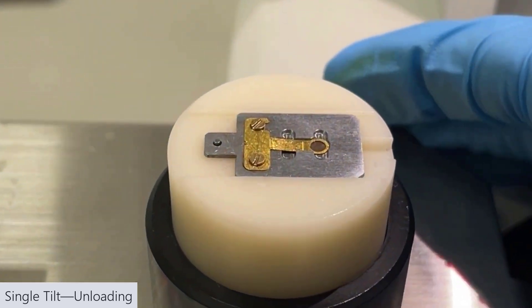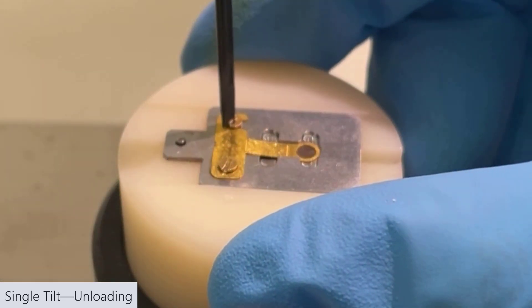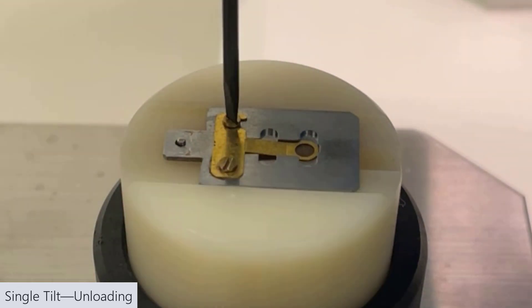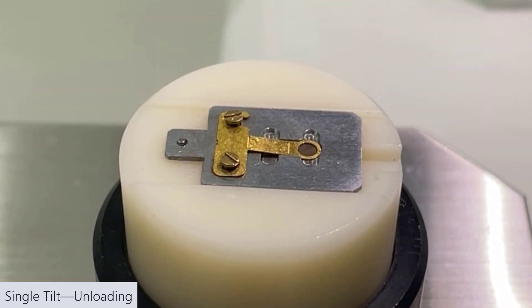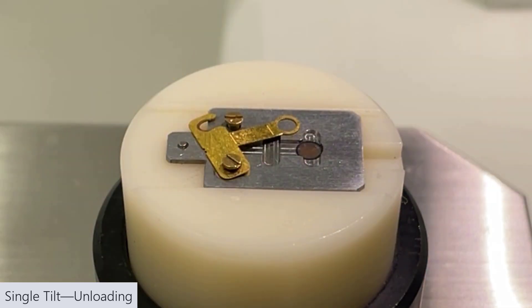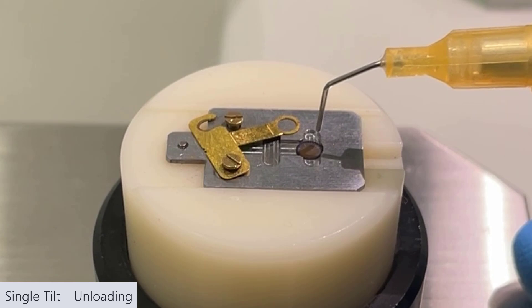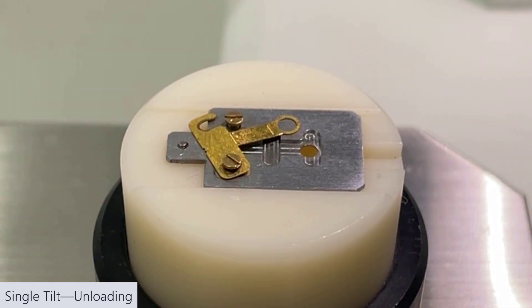Same deal. We'll loosen the two screws. Move the metal piece out of the way using some sharp tweezers. Pick up your grid. This is where I use the vacuum tweezers. Put that in your sample case.